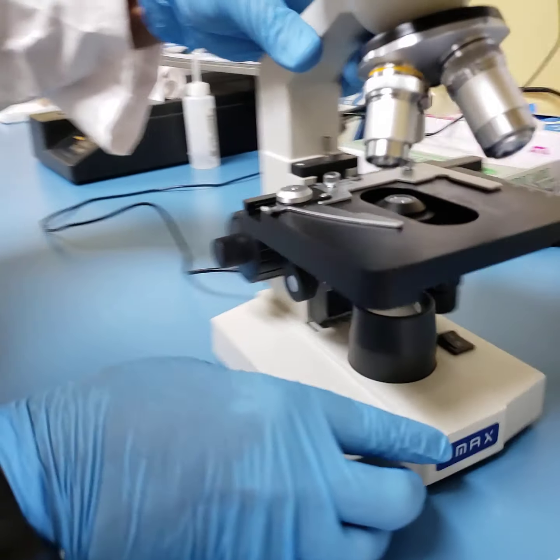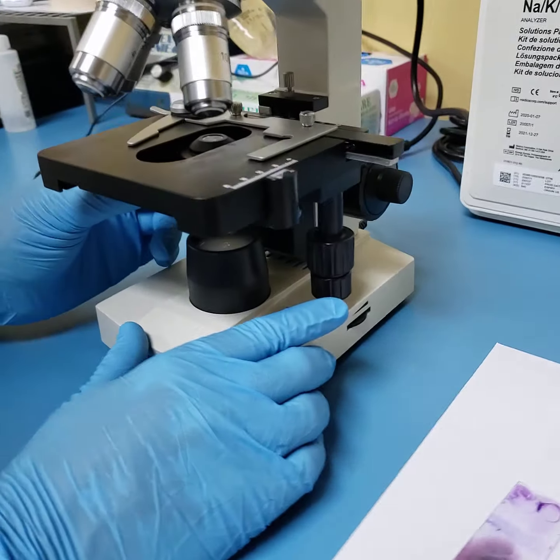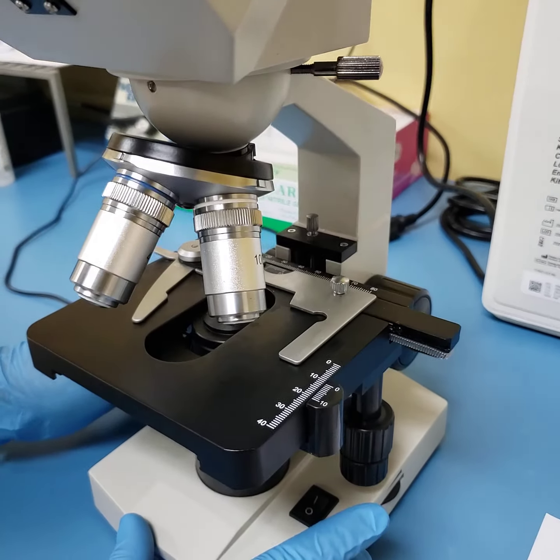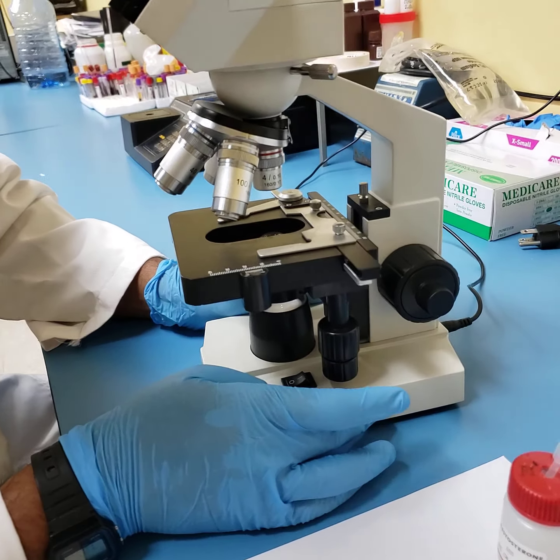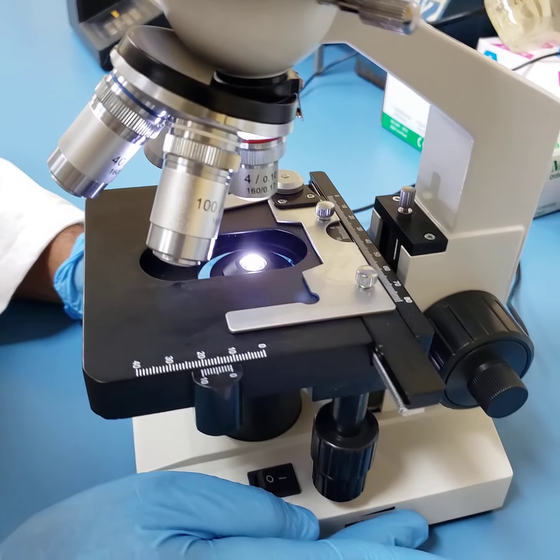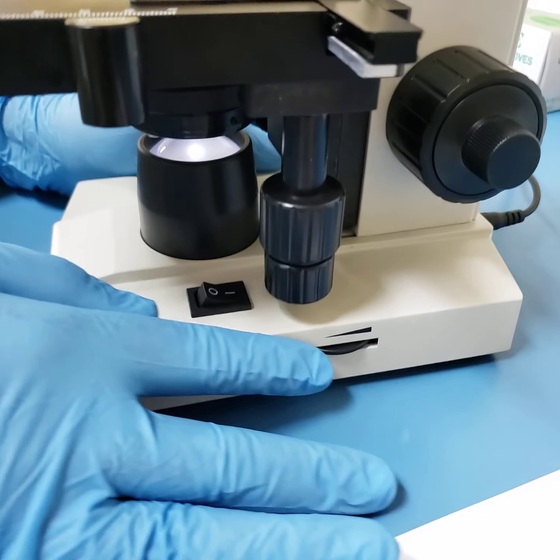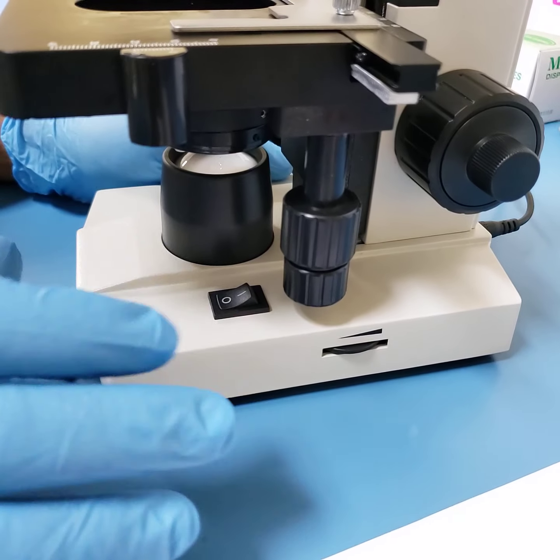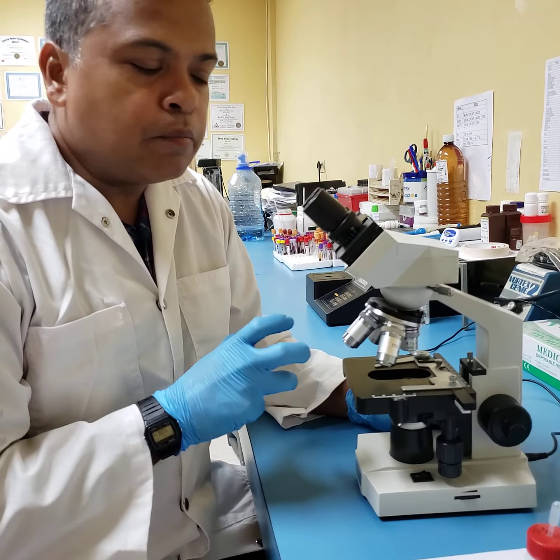All right, so with that, you've also got your condenser and your aperture diaphragm, and these are adjusted as you do your microscope work. Now, as in all microscopes, we've got our power knob that turns on the microscope, and we've got an adjustable capacity to increase or decrease the light intensity. All right, so I'm going to power it off now, and this here is the basic anatomy of your light microscope, your binocular light microscope.